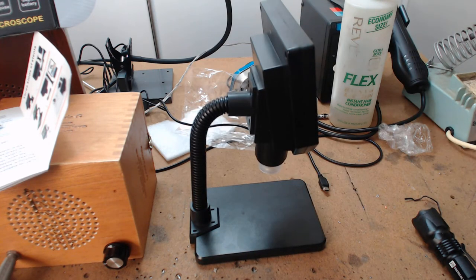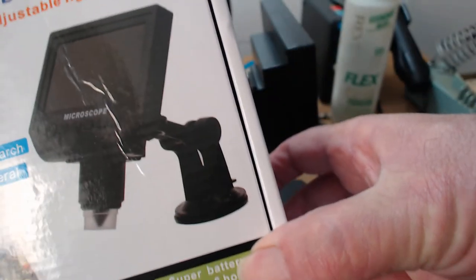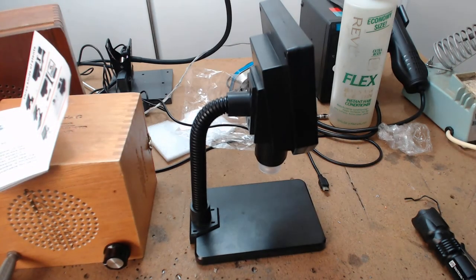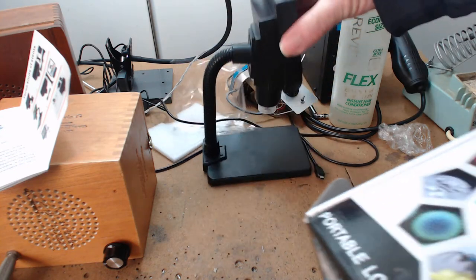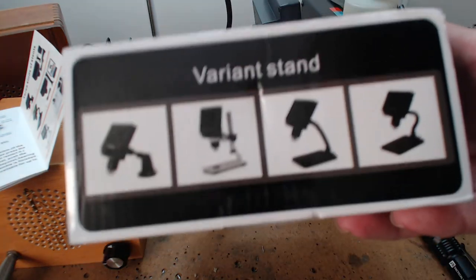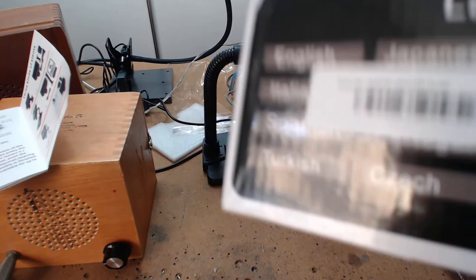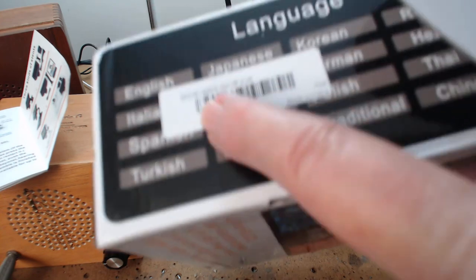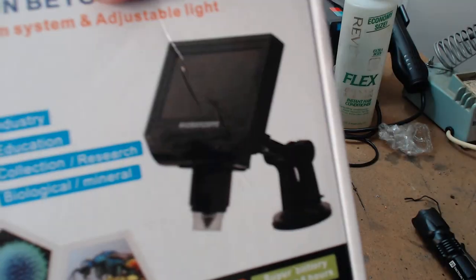Okay, now I want to show you Chinese. Well, you just don't understand Chinese. No? Okay, look at that stand. Look at the picture on the box. That's the suction cup model. Now, look at here, another one. Nice side panel. Let's move this out of the way. Side panel. Variant stand. What the hell does that mean? Does this little white label here, if you understand this code, can you tell what's in this box? That's the problem with Chinese crap.